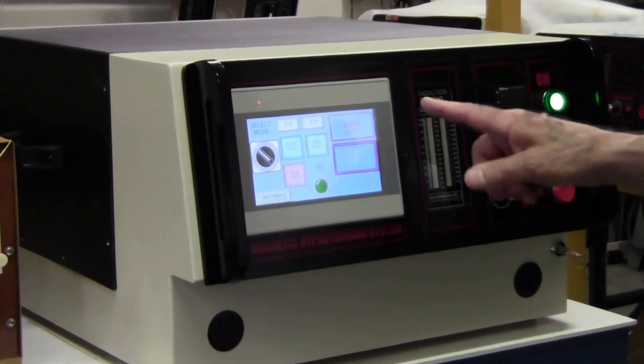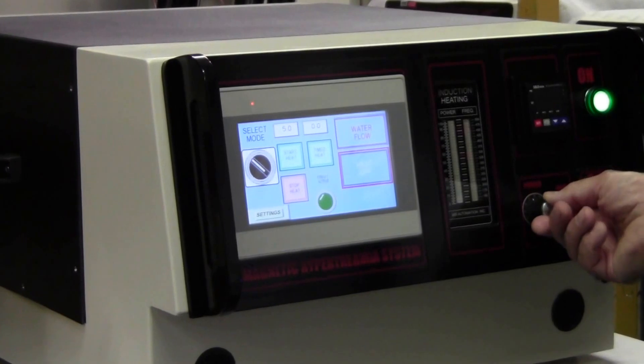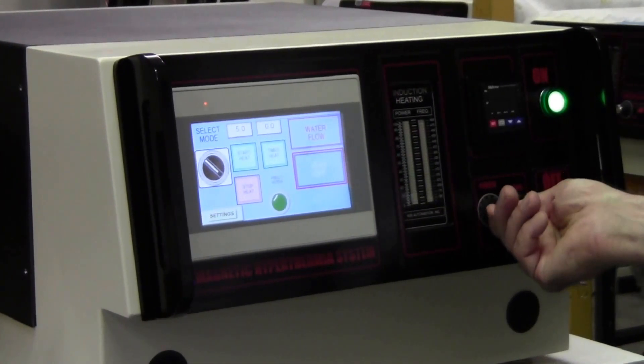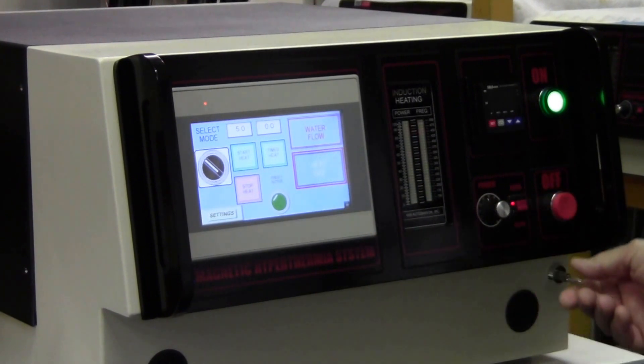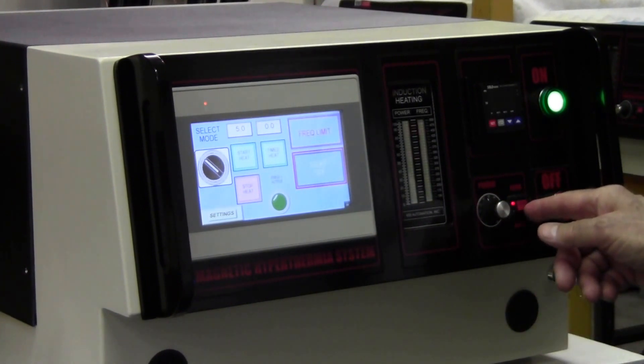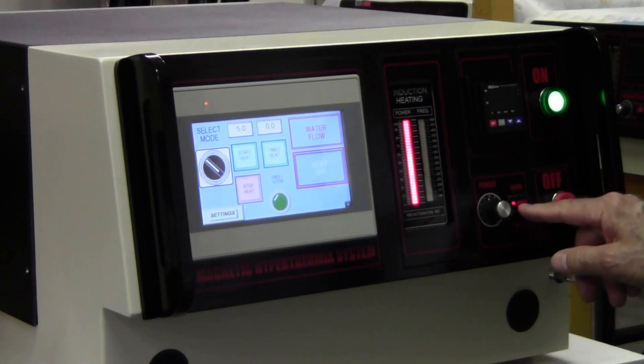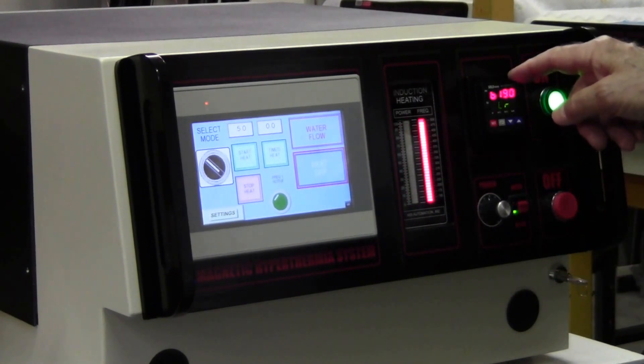While it's going through the startup procedure, I'll just explain. We have a manual power control here, zero to one hundred percent, and then you have a switch next to it. Go to the automatic position.